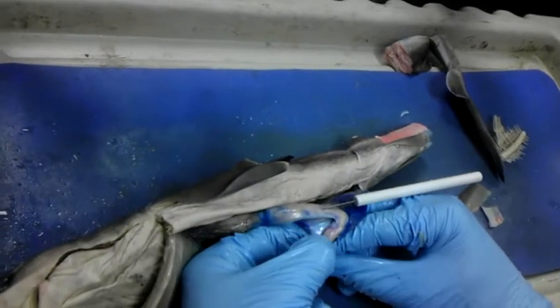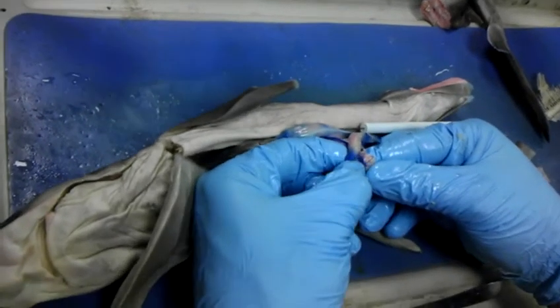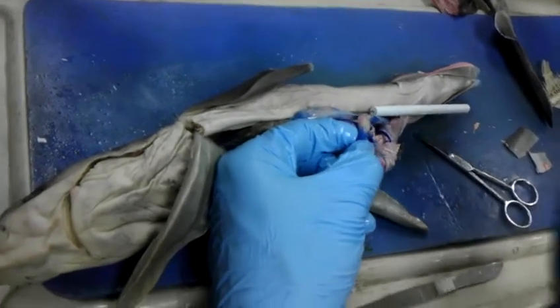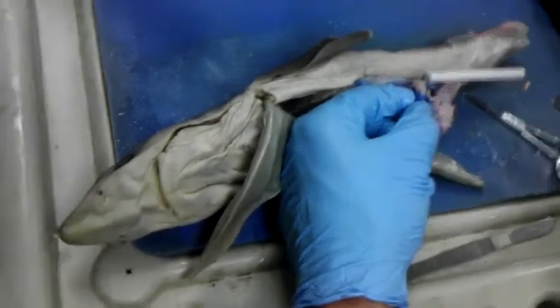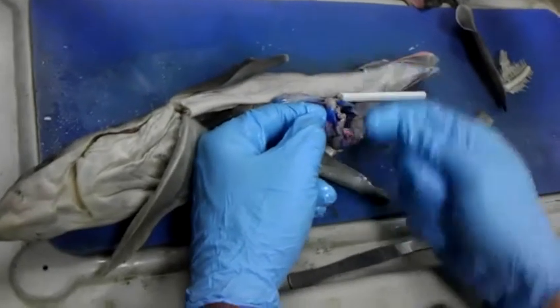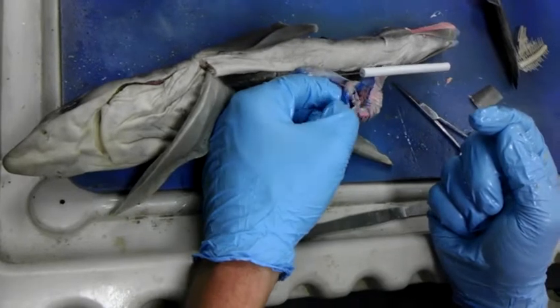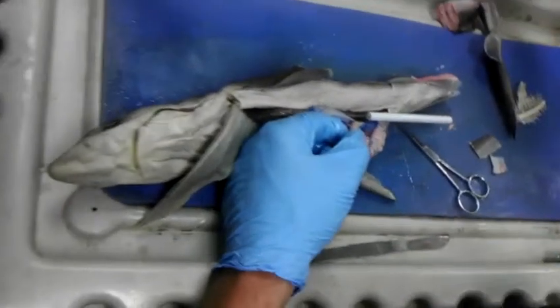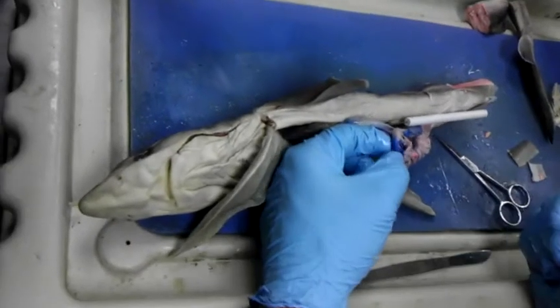This is the stomach here. And you see this little notch? The reason why it's notched is that you've got the real intense pyloric sphincter muscle. Sphincter muscle is a circular muscle, and this closes off and keeps things from moving back in. Except, anybody remember the exception to that? When you're really puking bad, sometimes that relaxes and you puke from your small intestines as well.